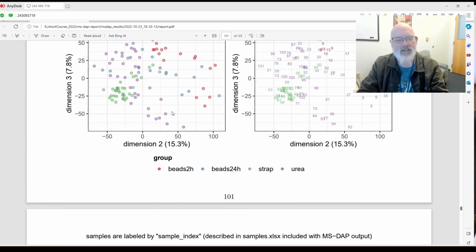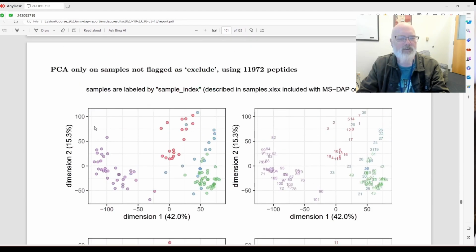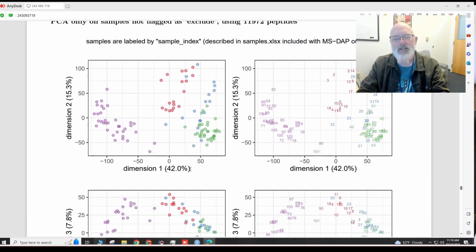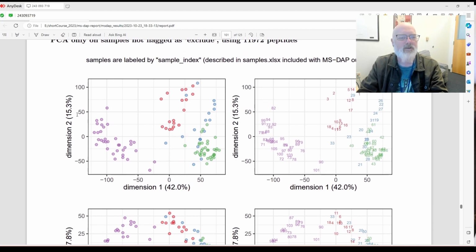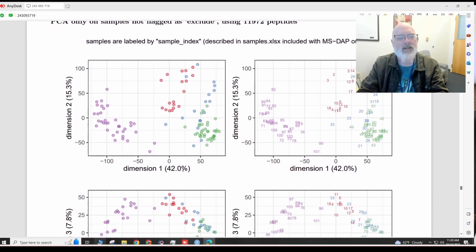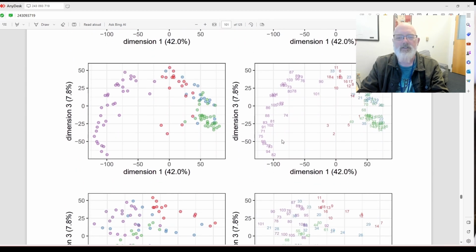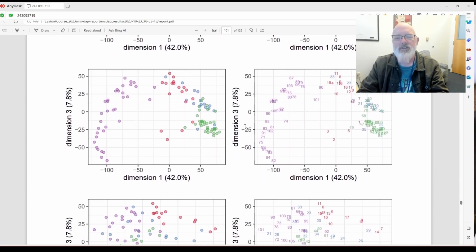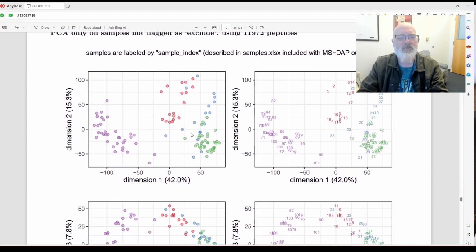And this is just using the different dimensions, like 2 versus 3. And I only usually ever do 1 versus 2. You can tell what's important by looking at the percentages. So this is the percentage of the variation, I think, captured in the principal component analysis. So larger the better. So 42 over 15. You can see that gets smaller as you do, for example, 42 versus 3. I usually only do the top 2. So 42, dimension 1 versus dimension 2.